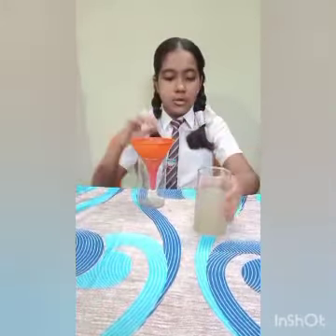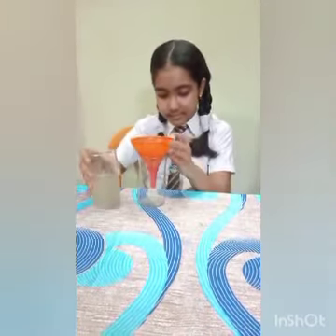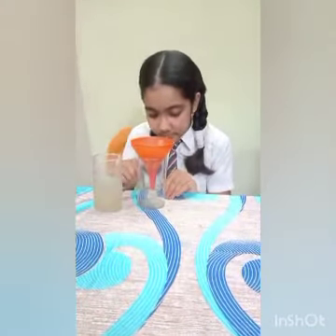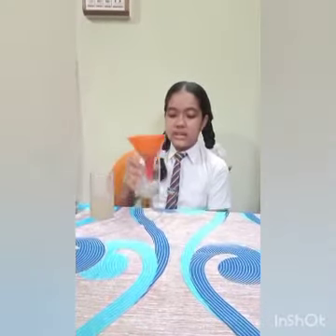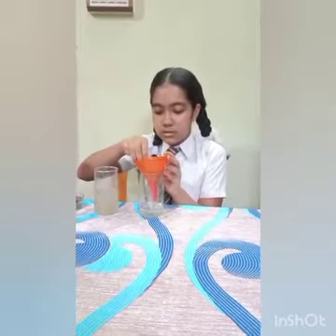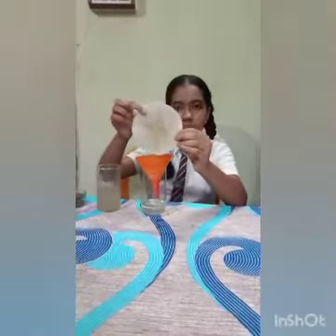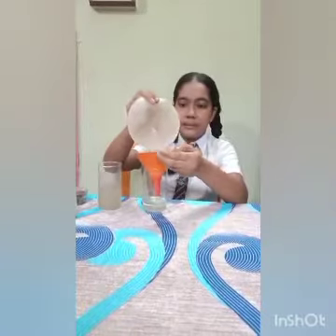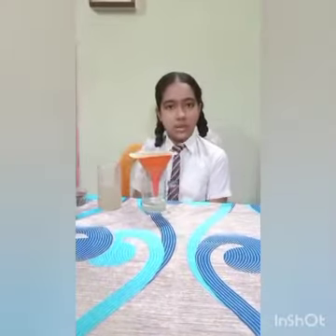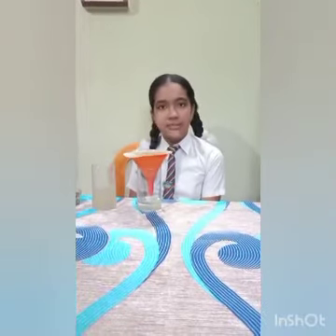Now I am going to pour the water. So after a few minutes, the clean water has come down. Now I am going to show you the condition of the filter paper. So this is the condition of the filter paper — all the dust remains in the paper and this process is called filtration. So this is the process of sedimentation, decantation and filtration. Thank you.